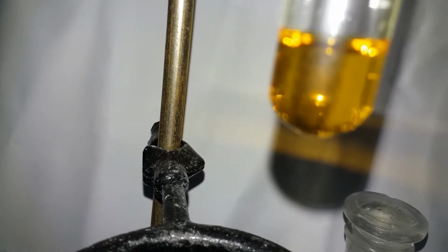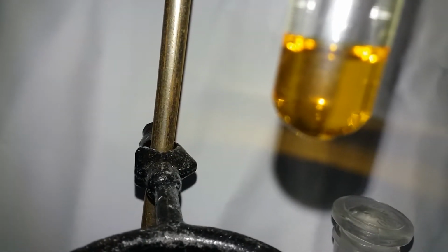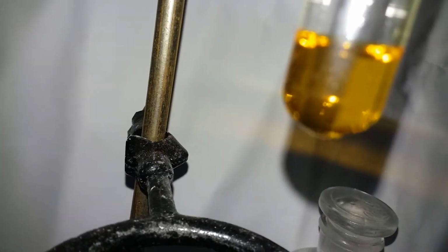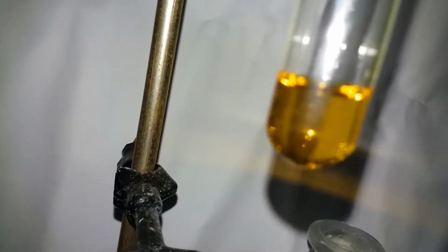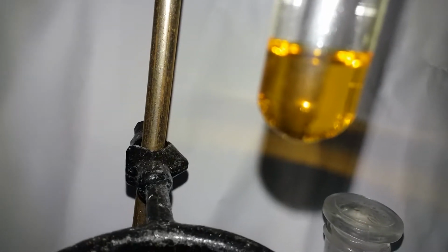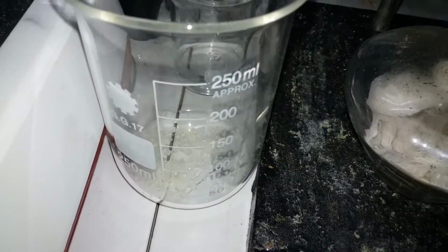But it's really messy. Iodine fumes are gonna just escape, gonna fill your whole lab or maybe even your house, gonna sting your nose and other bad stuff. So well, it's better to do it in this method, like potassium iodide, sulfuric acid, and hydrogen peroxide.